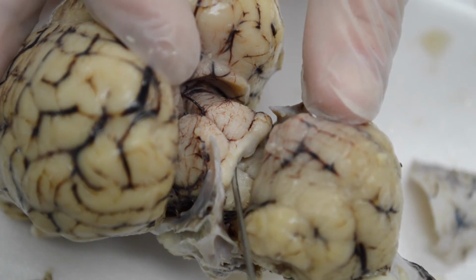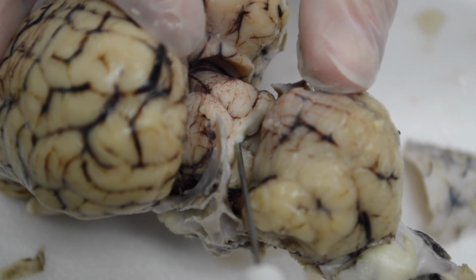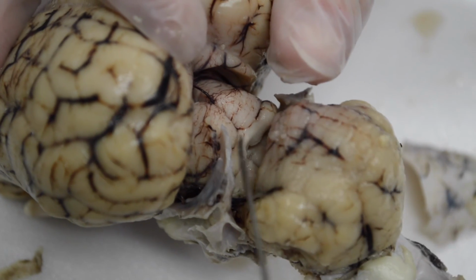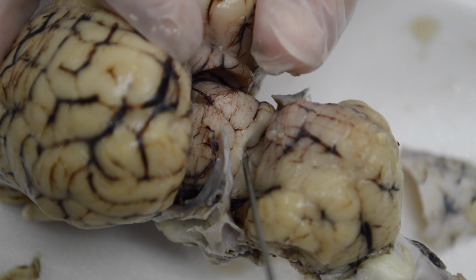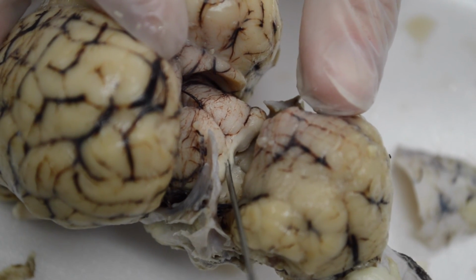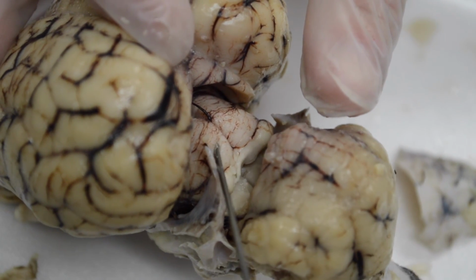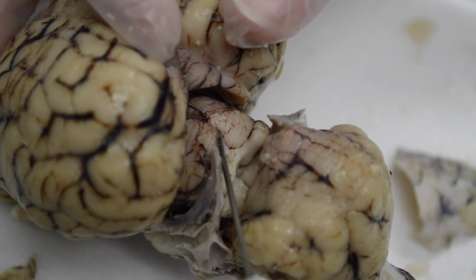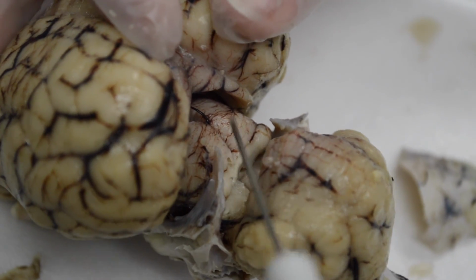The lower two structures, the inferior colliculi, are associated with sound and kind of loud sounds like surprise, right? Changes in volume. So the bottom ones are with sound and hearing. The top ones are with vision. Together they are called either the tectum or the corpora quadrigemina. Quad is in four different structures.